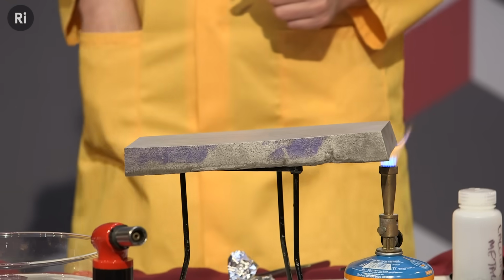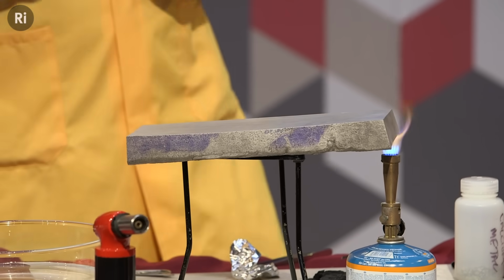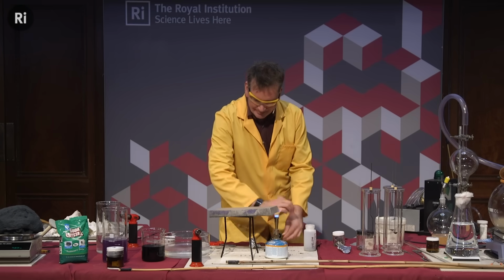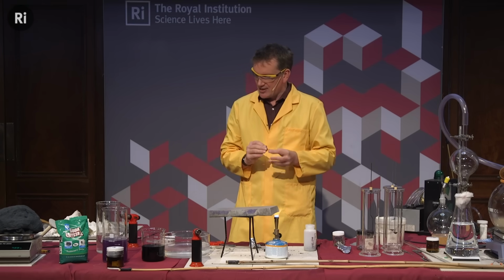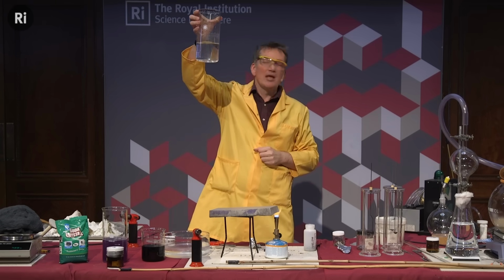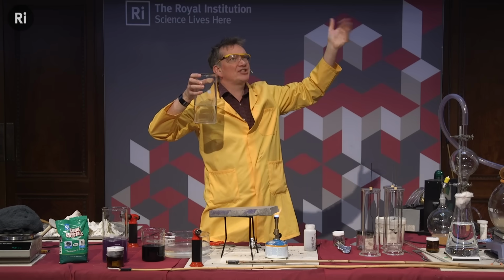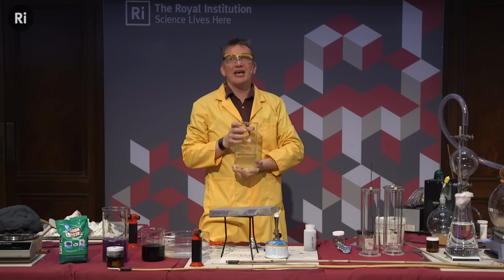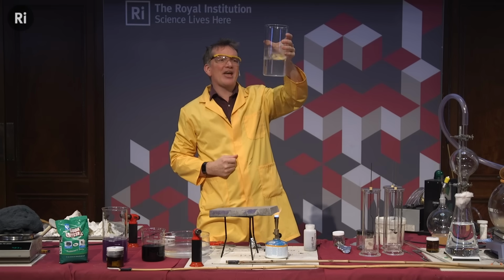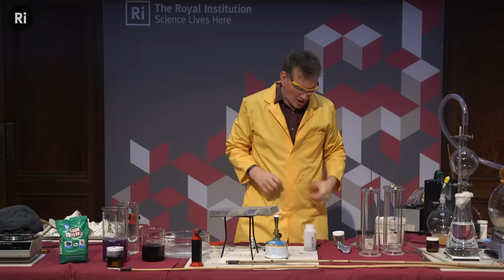So while we're waiting for that one to get going, well, we saw the lithium and the sodium react very violently with water. What about our magnesium? So if I take a little piece of the magnesium ribbon, so here is the magnesium. If I add this to some water, well, it sinks. In fact, it's only our group 1 metals, only the lightest of those, so it's lithium, sodium, potassium, these are the only metals that are less dense than water. So even all the ones from group 2 sink, but actually even this is not reacting very quickly. It is very, very slowly reactive. If I heated up the water to a high temperature, it would react.